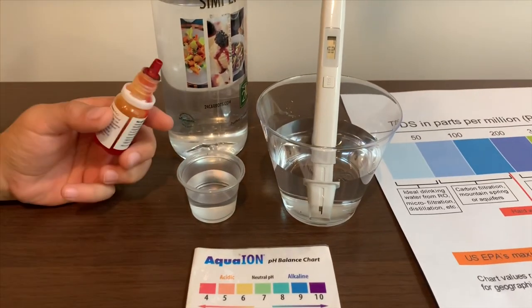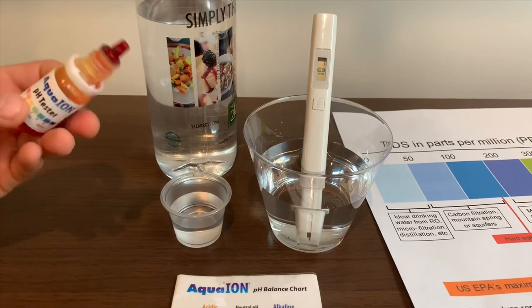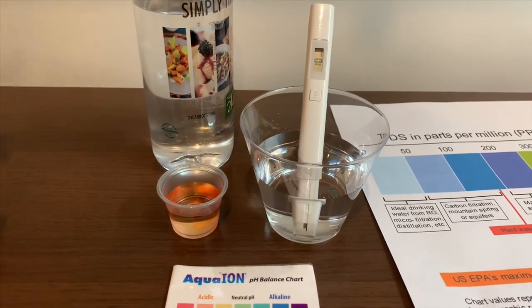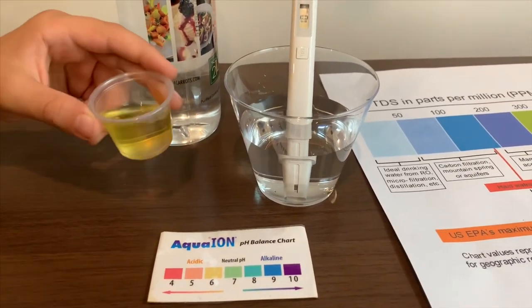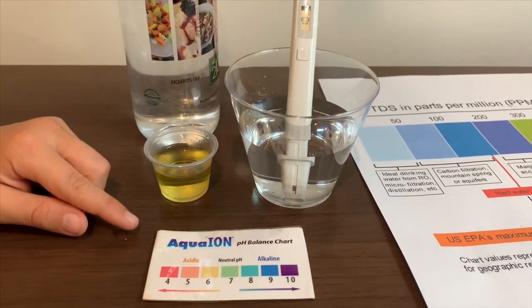Now let's test the pH level. If you want to buy this pH tester, check the link down below. Let me do two drops. Let's stir it a little. I'm giving this a 6.5 — just a neutral pH.